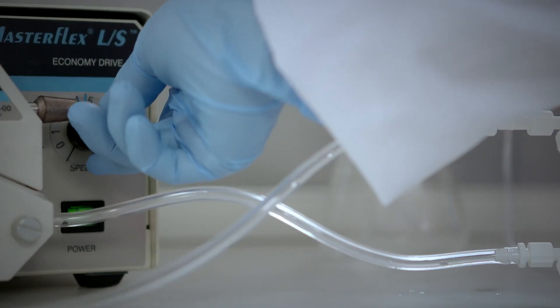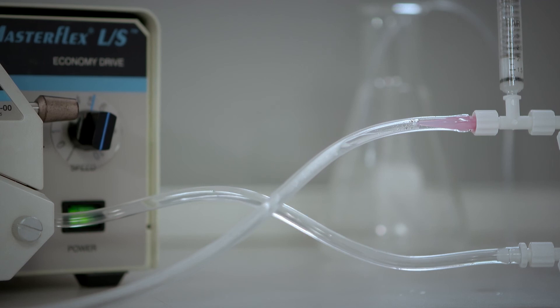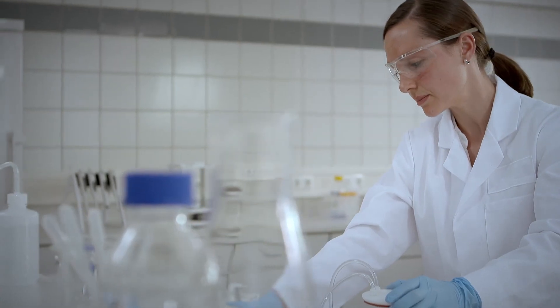Switch on the pump and slowly increase the pump speed up to a maximum pressure of 3 bar or 45 psi.